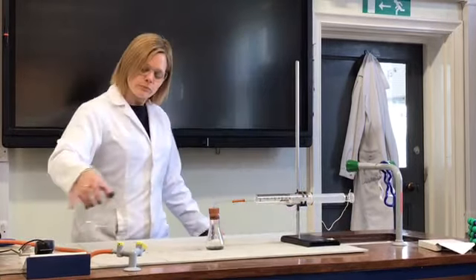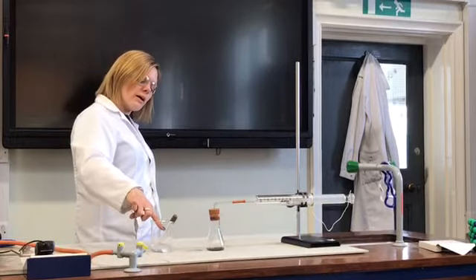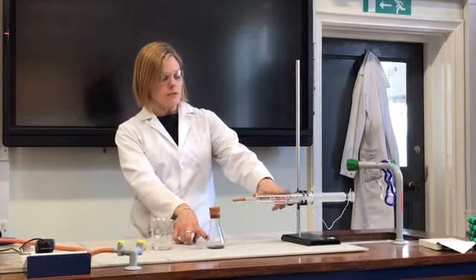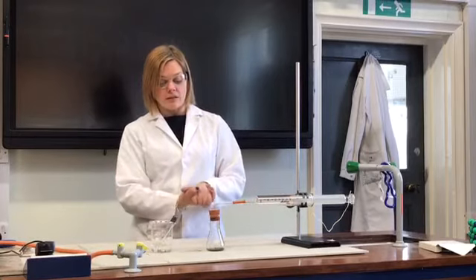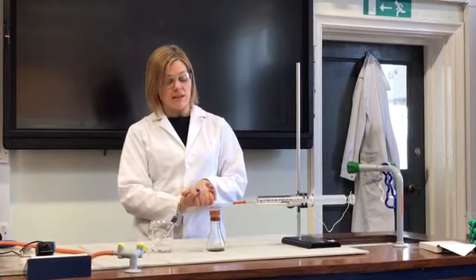So again, just like this one, we've got a starting volume here and a starting volume, which is all of this stuff. We now need to leave that to rust for a week at least, I would think.